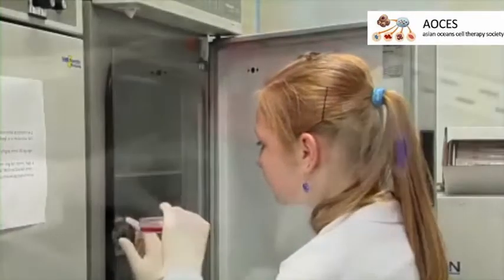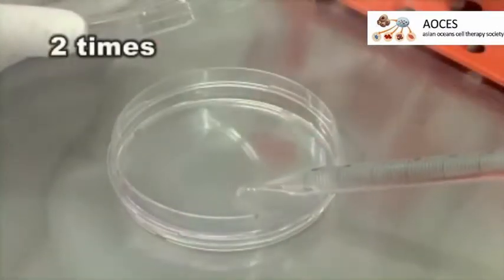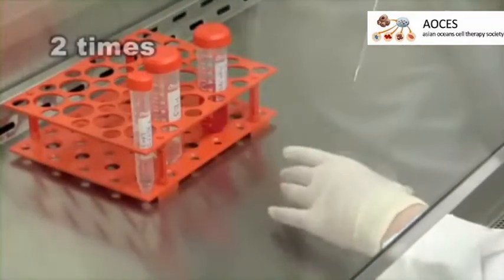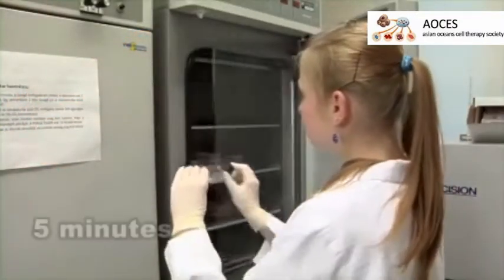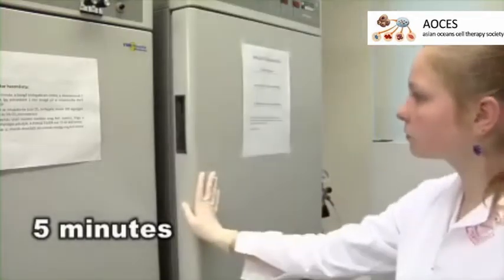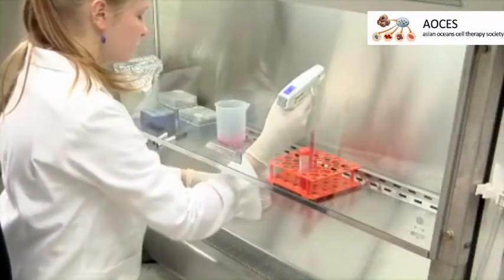Remove culture medium from H9C2 cells. Wash cells twice with PBS and digest with 0.05% trypsin EDTA. Place petri dishes for 5 minutes in a 37-degree incubator. Inhibit trypsin with DMEM culture medium.